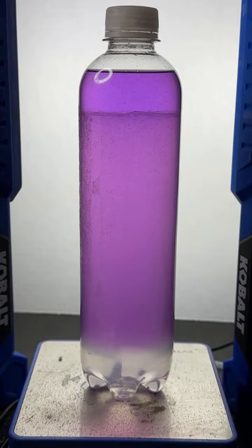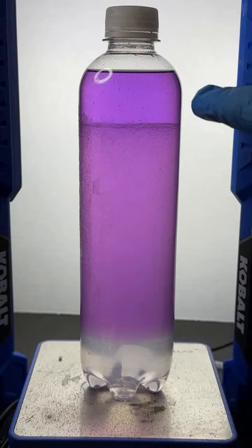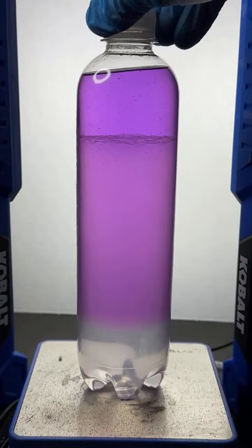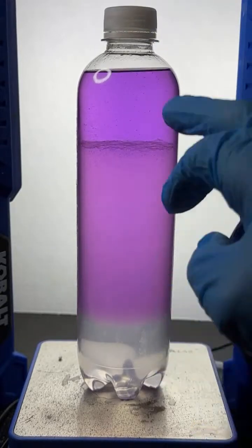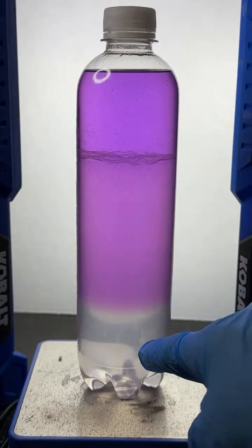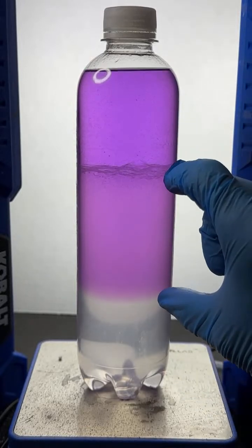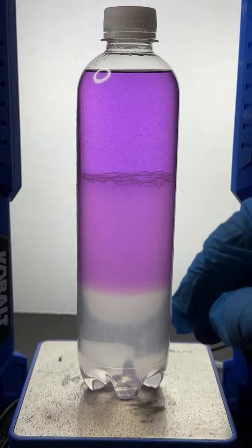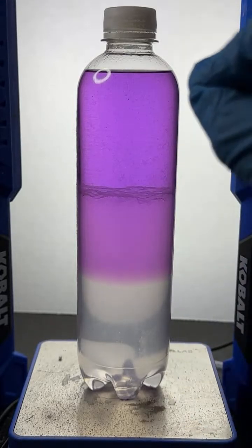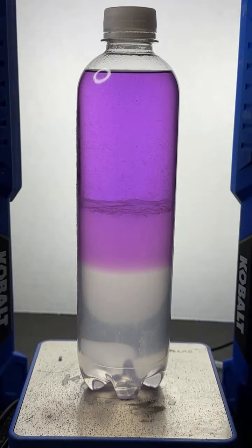You can like see the three different layers. So you can actually see three different layers. We call this layer the salt water layer. This layer up here is the alcohol layer, and then in between there's a third layer. You can see it's got a different shade than this violet up here. And in this layer, the salt water and the alcohol layer, they're mixed, but it's a transient mixture. You can watch it shrink over time. And these types of layers like this that are transient, we call them an emulsion. So this is the emulsion layer, and you can watch that emulsion layer shrink over time.